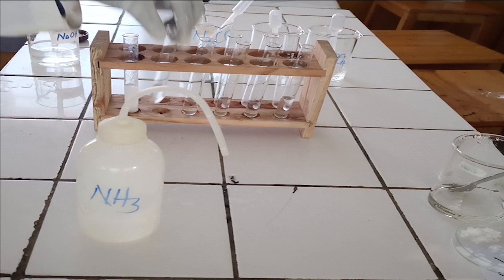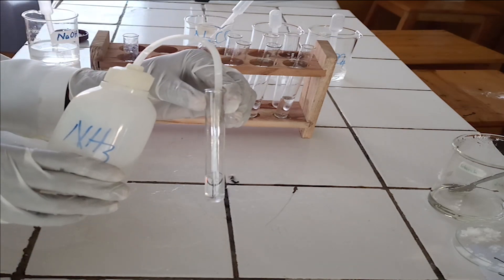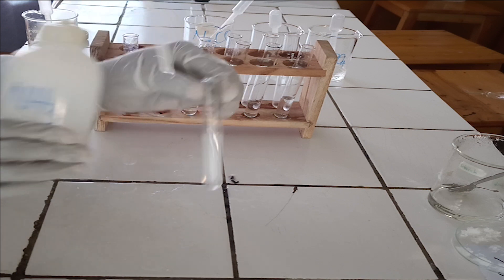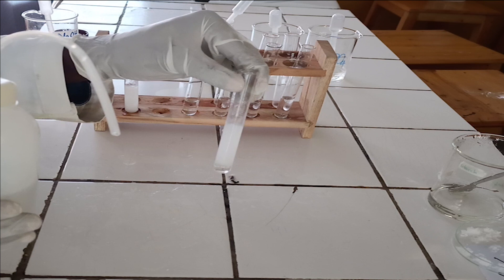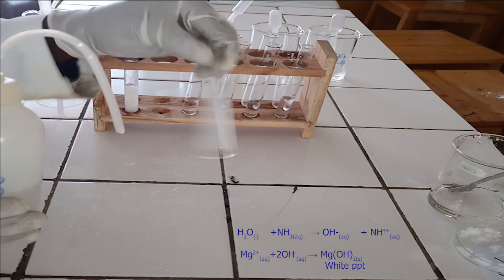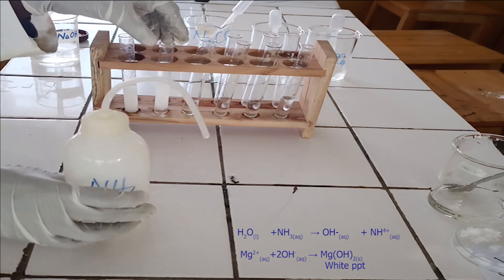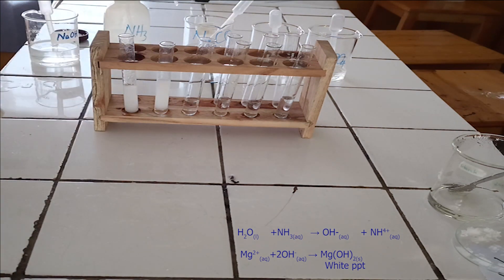To the second test tube, add diluted ammonia dropwise until in excess. As you see, ammonia solution reacts with magnesium ion to form a white precipitate, which is insoluble in excess of ammonia solution. Below, there is the ionic equation for this reaction.